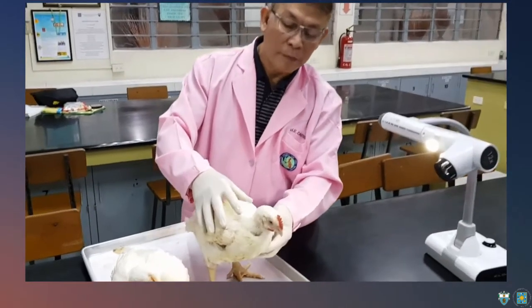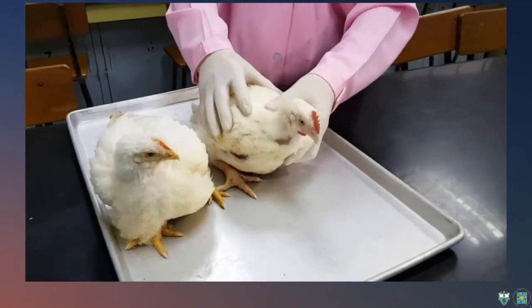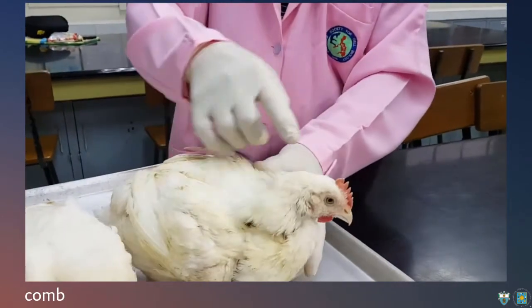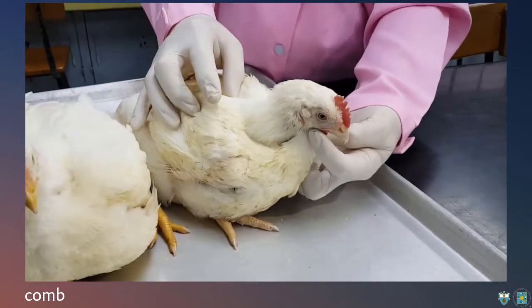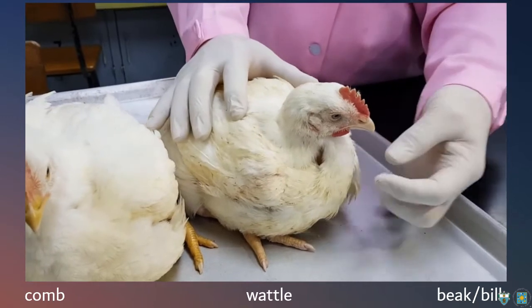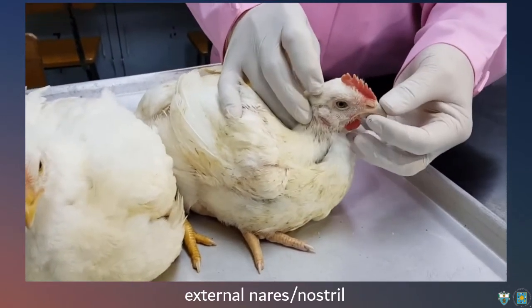Alright, so we have to distinguish between the male and the female. Male and female, yes. Okay? So if we look at the parts, we start with the comb. Okay? The comb, and then we have the wattle. This is the beak or bill. And then that should be the external nares or the nostrils.